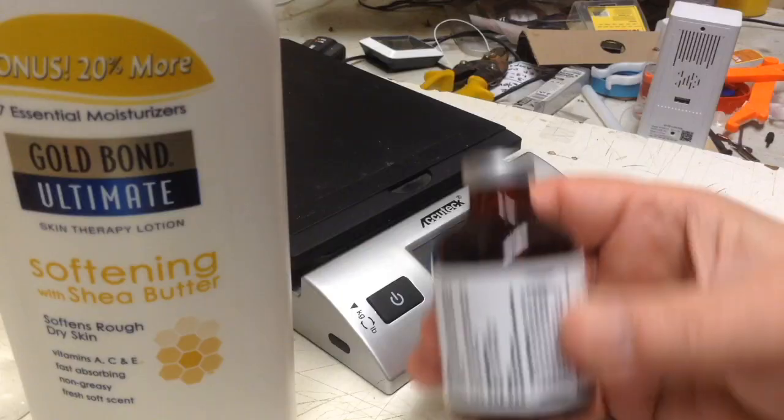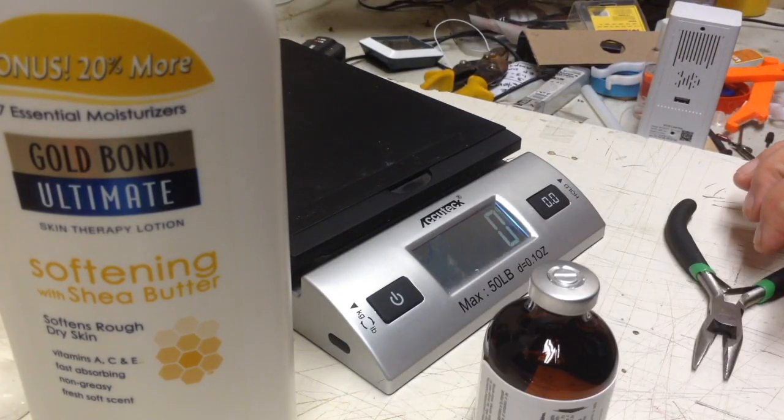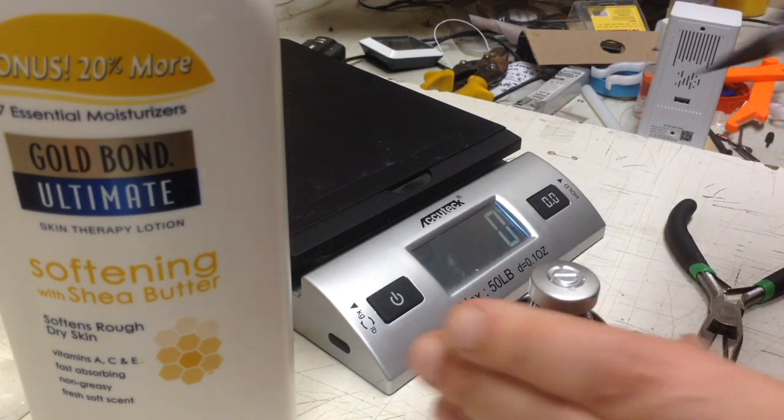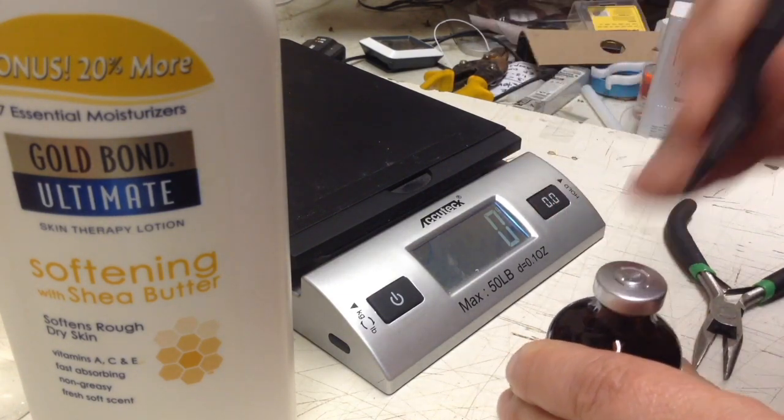There's the bottle. You can see it's sealed. There is just a seal right in the center here. There it is.